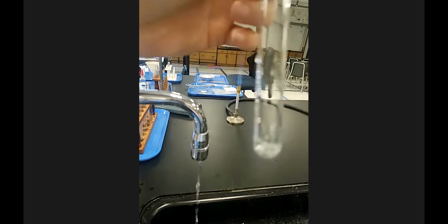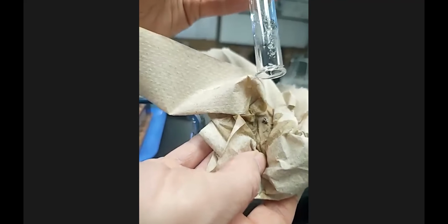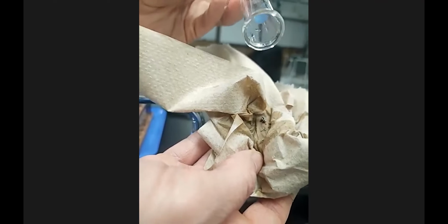What I'm going to do, I'm going to grab a paper towel here. And for solids, it'll say either put in a certain waste beaker or collect the solid remains in a paper towel. So once you've rinsed it, and you don't have a bunch of acid in here, you can dump this upside down, tap the test tube to collect the solid. And if it said to toss the solid, you would do that, or whatever it said to do with it. It might say pour it through a filter paper like I was doing earlier.